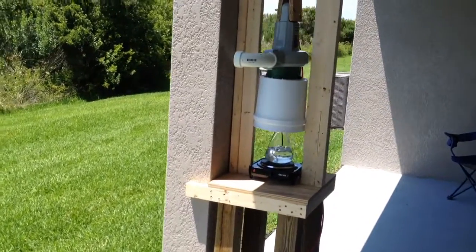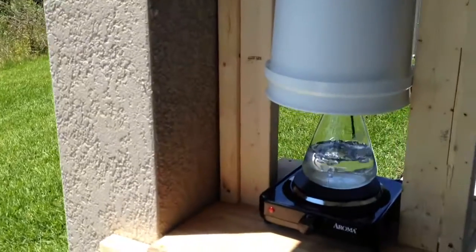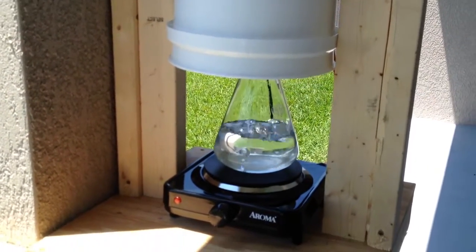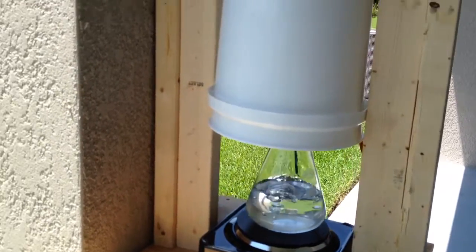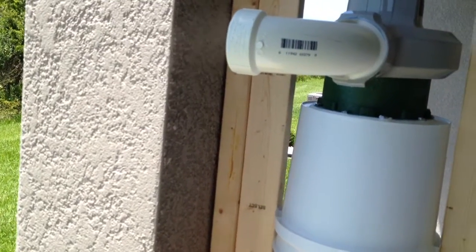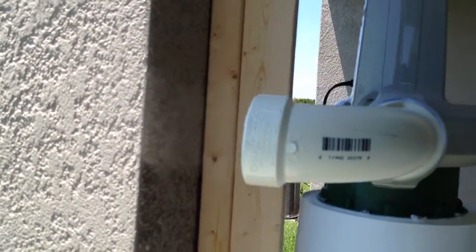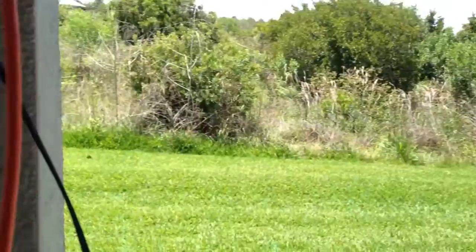You can see here that I've got a cheap burner that I picked up at a chemical supply house. I've got a flask with some boiling water that I'm using just to test how it works. Actually, it works even when the motor's not turned on. I don't know if you can see that - there's fumes coming out of it right now. Let me put the camera up in there, though I'm not sure you'll be able to see that very well.